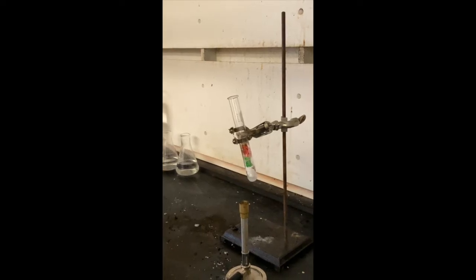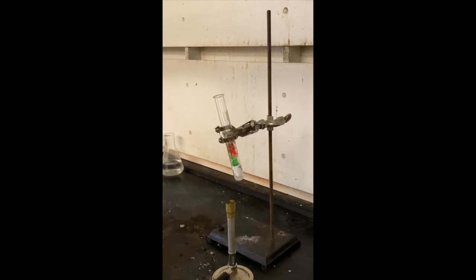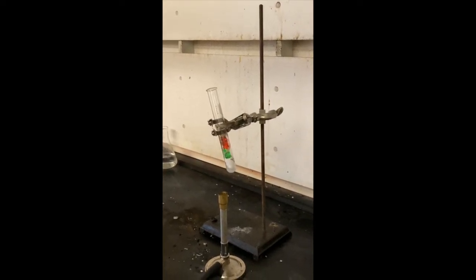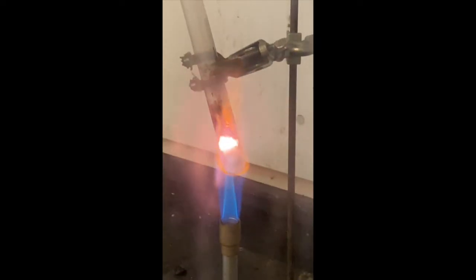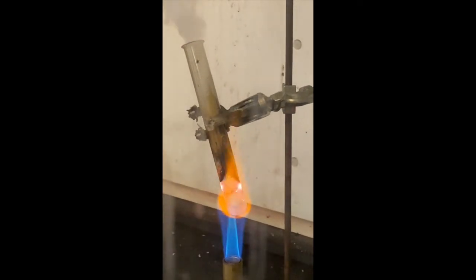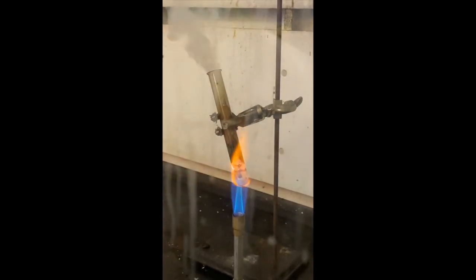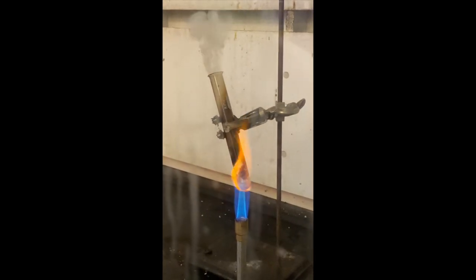This reaction is a redox reaction, and during it, what should have happened is the potassium perchlorate should fully form, then fully decompose, creating enough oxygen for the sucrose in the gummy bear to fully react, leaving behind CO2 and H2O. In this experiment, this doesn't happen fully due to there being leftover reactants not fully decomposed in the test tube.